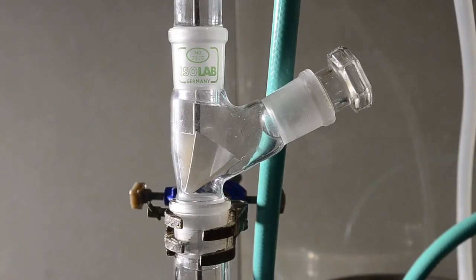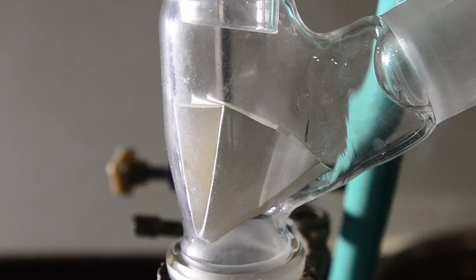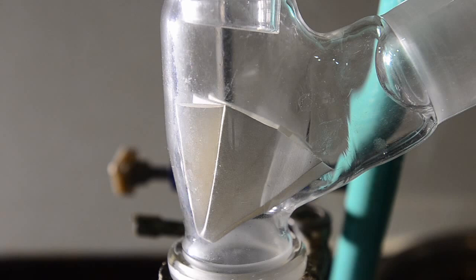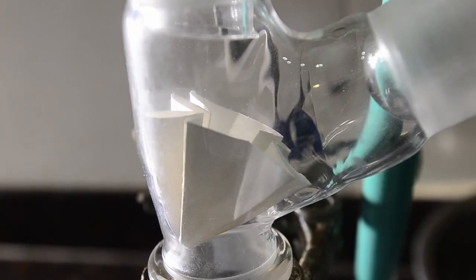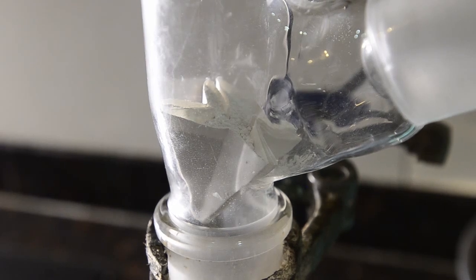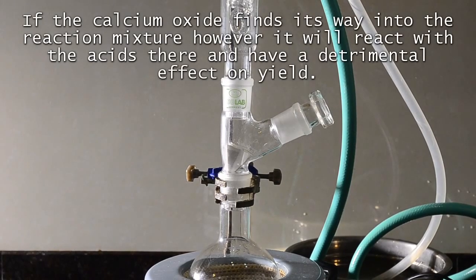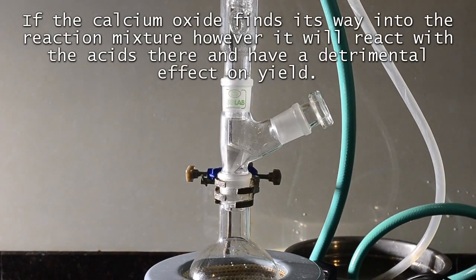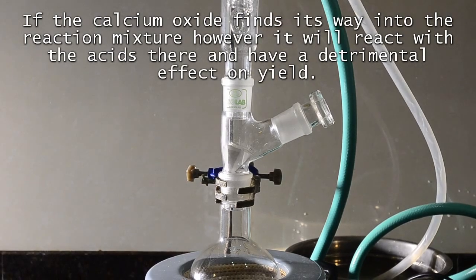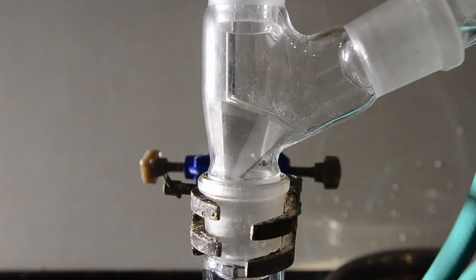We put an adapter between the flask and the condenser and placed a cut-down fluted filter paper into it like this. The idea is that the vapors can come around the sides of the paper, but the drops of condensing liquid will fall into the middle and filter through the paper. And we've placed some calcium oxide into the paper so that the ethanol will drip into this. It's important though that none of the calcium oxide makes its way into the flask. Calcium oxide is alkaline and will react with both the chloroacetic acid and the sulfuric acid catalyst.